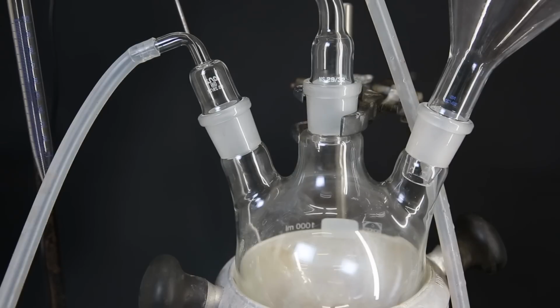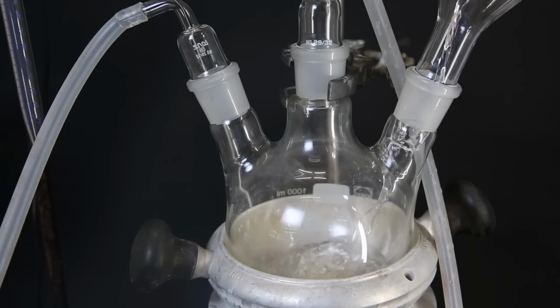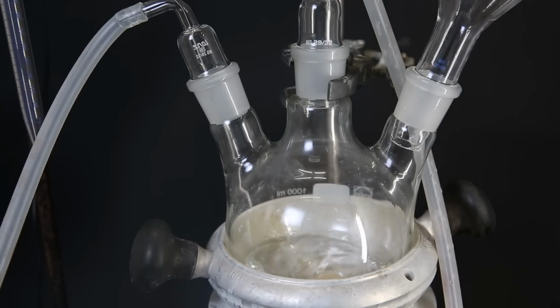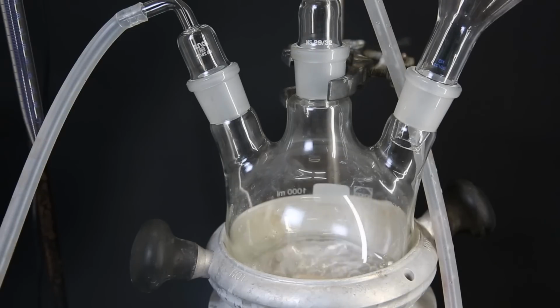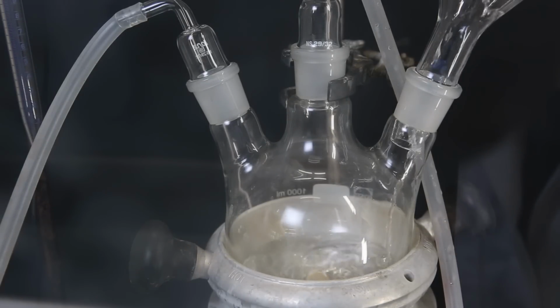Because the reaction is sensitive to oxygen, I flush the apparatus with argon. Normally you can do this reaction under constant argon or nitrogen flow, but since it takes 24 hours I'm not going to do that. So to start the reaction, I first add 100 ml of cyclohexanone to the flask. Then I add 120 ml of pyrrolidine.